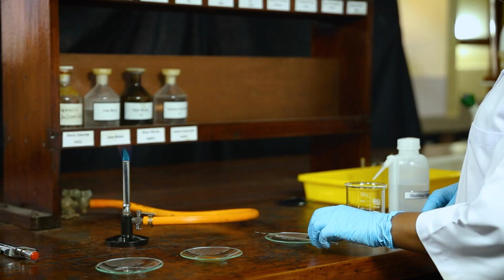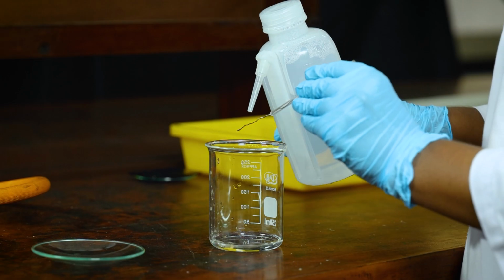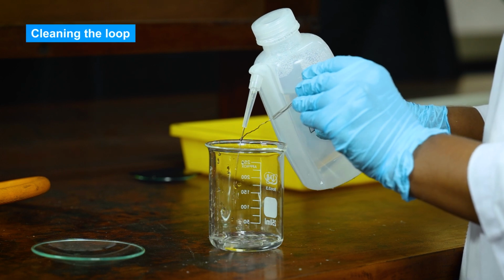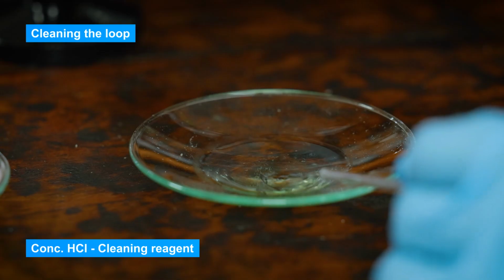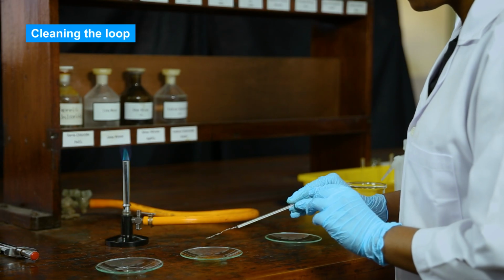Now I will demonstrate how to perform the flame test using one of our samples. First, clean the loop with distilled water. Then, clean the loop by dipping it in hydrochloric acid. Finally, place the loop in a blue inner core flame to see how clean it is.